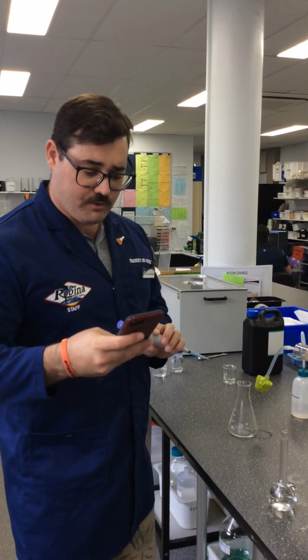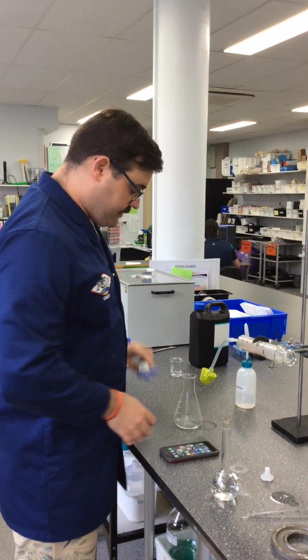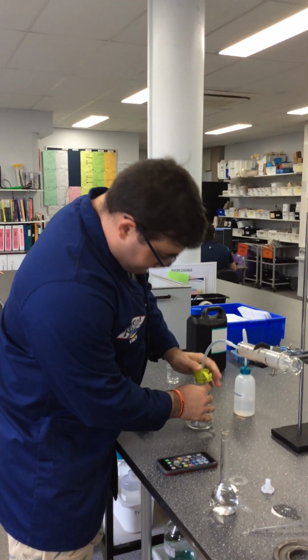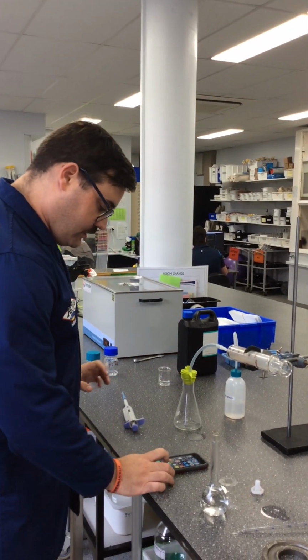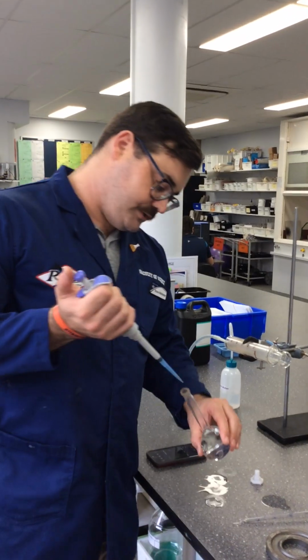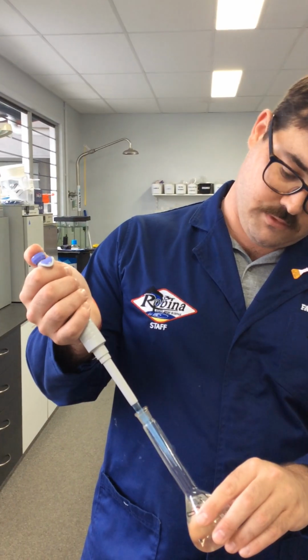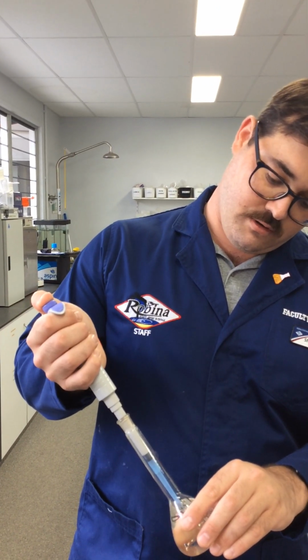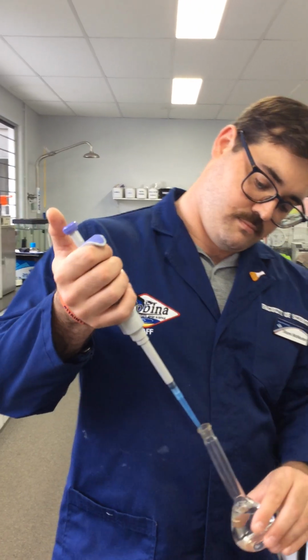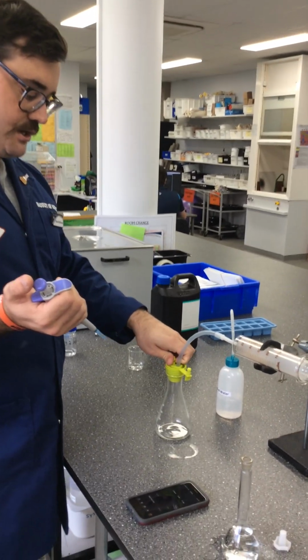All right, I'm going to get our timer ready. Oh, first we need to push this back to 0. Okay, we need to put our lid on. Again, nice and tight. All right, get our timer ready for 30 seconds. And then we are going to suck up our Catalase solution. So push down. Suck it up. All right, and we are pretty much ready to go.